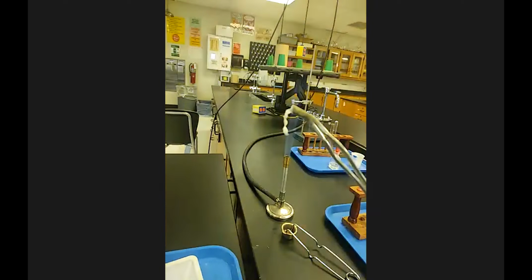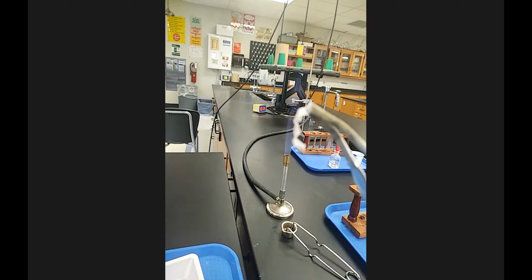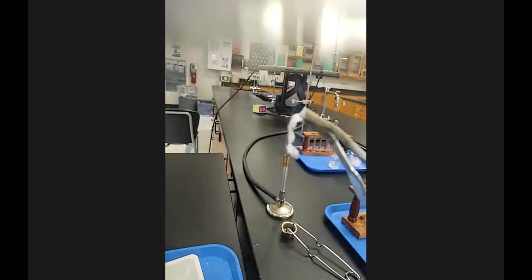The beautiful rose pink color that you saw, you can only see that if you look at magnesium burnt through cobalt glass, because your eyes get over-inundated with the brightness, and without it your eyes can't see it. And so that's actually a lab technique that now the other chemistry teachers at West High use. So I shared it with them. And here is the big piece after it's burnt. And I'm going to set that down in the watch glass right here.